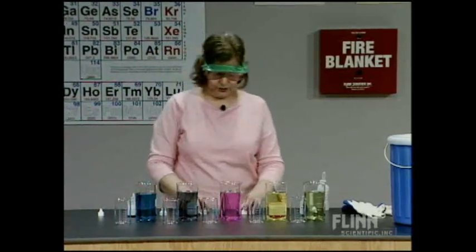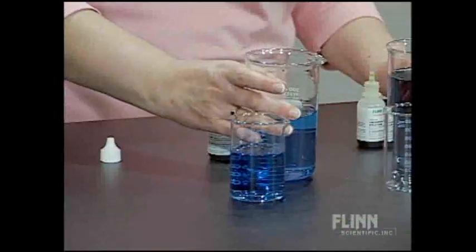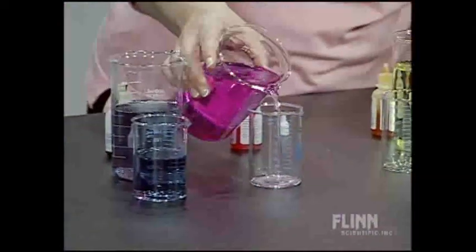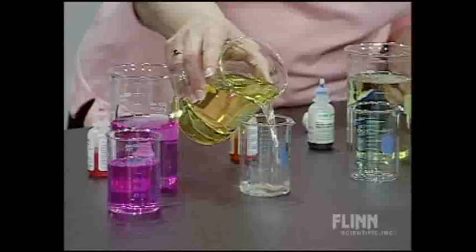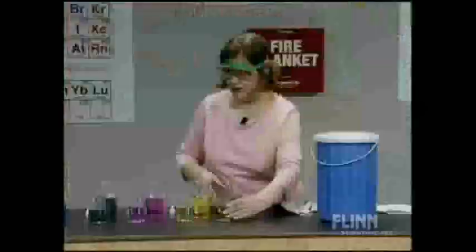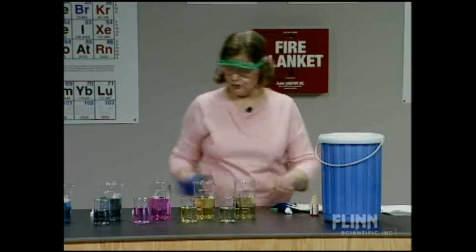What we want to see are the color changes that occur when we add dry ice. Because if we're going to see a color change, we need to know what the initial color is. So I'm going to pour a little bit of each initial color into the beaker in front of it, to give us a control or reference set of beakers. We've made sure we have the basic color for all of these. When we add CO2 and it dissolves in water, it produces carbonic acid, H2CO3, which dissociates to give an acidic solution. We should see for each of these a color change to the acid color.